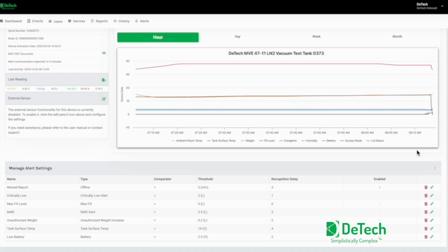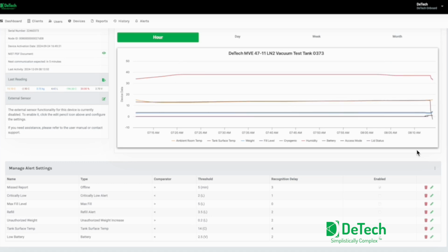You can see the surface temperature dropping as we're filling the tank. And you'll notice that the fill level is also increasing with the weight. The lid is still open as indicated by the graph. And then as soon as we're done filling this tank, we're going to remove the hose out of it. And we're going to put the lid back on.